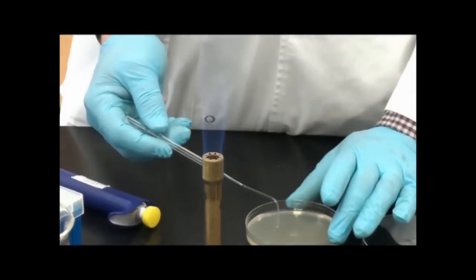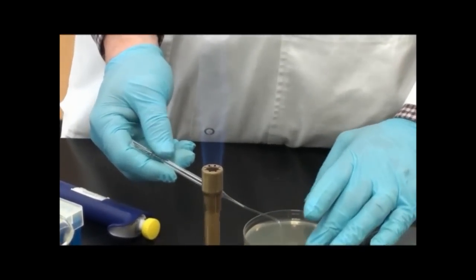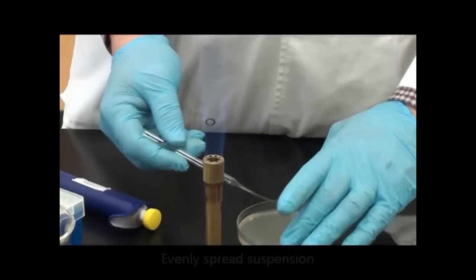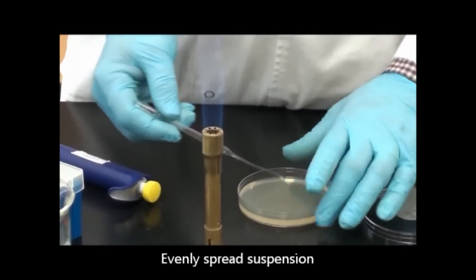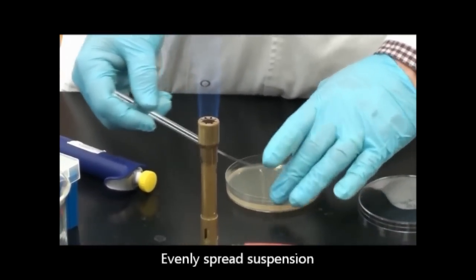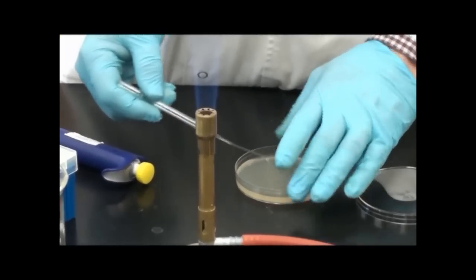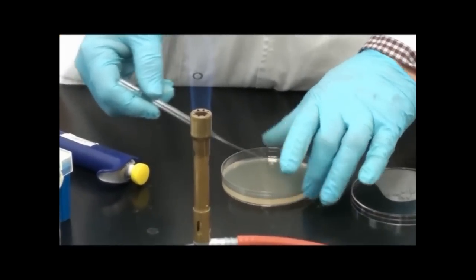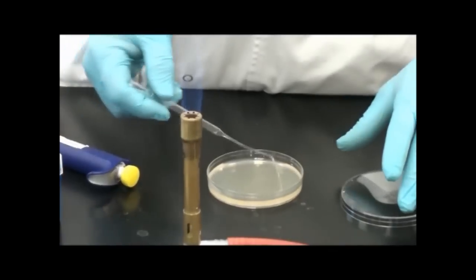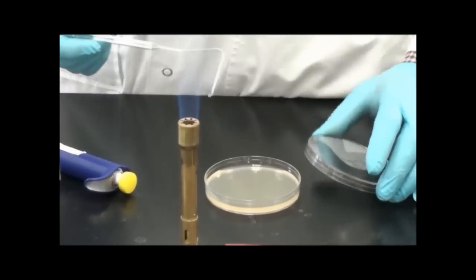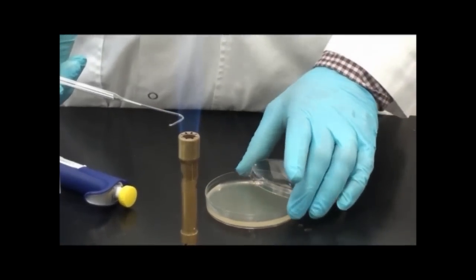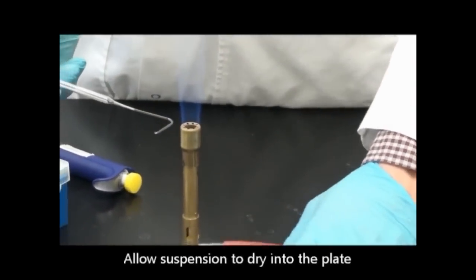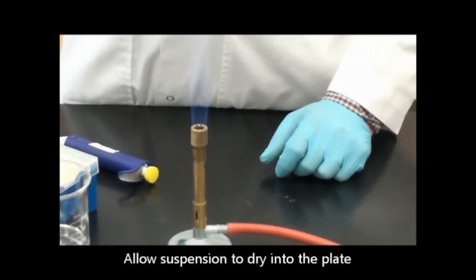Now I'm cool enough. I'm just going to take my spreader and move it back and forth as I rotate the plate. I'll spread that suspension out evenly across the plate. Then I need to let that suspension dry into the plate before I can incubate it overnight.